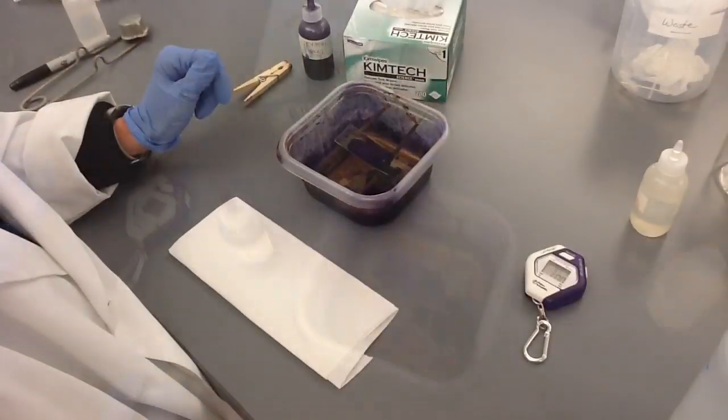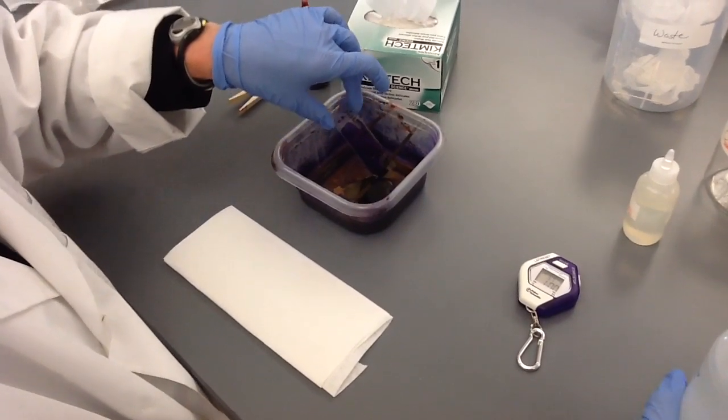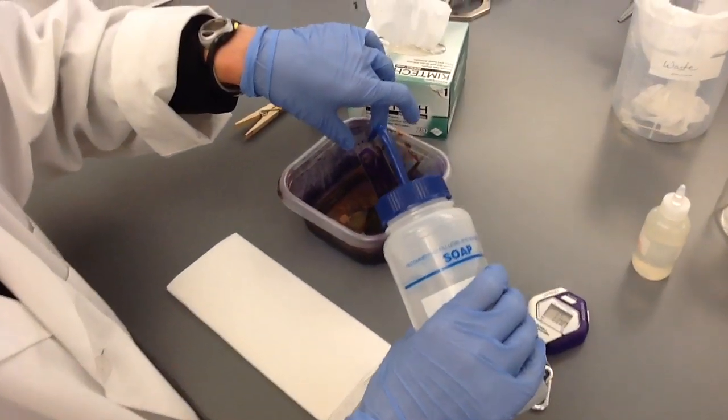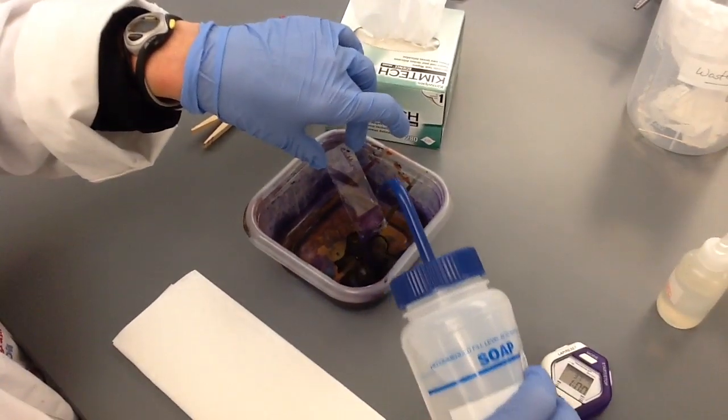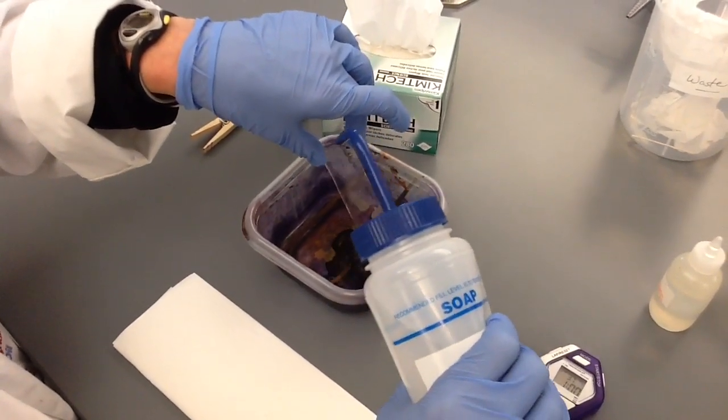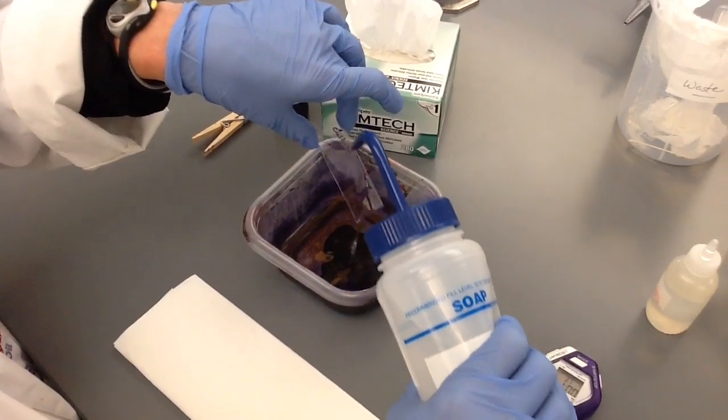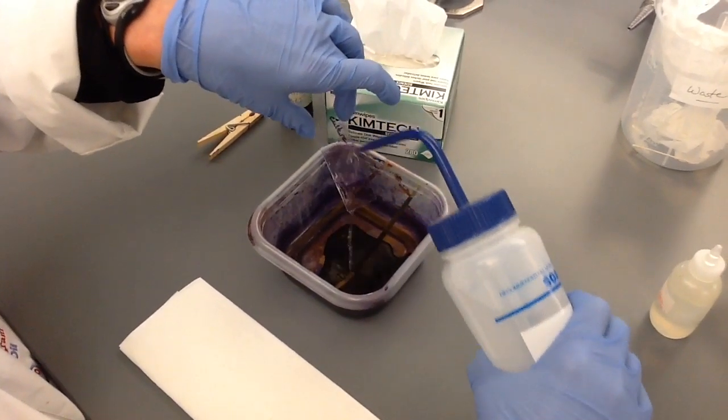60 seconds have gone by. You take the slide, tilt it, and gently wash from the top with deionized water until the water coming off the slide runs clear as shown.